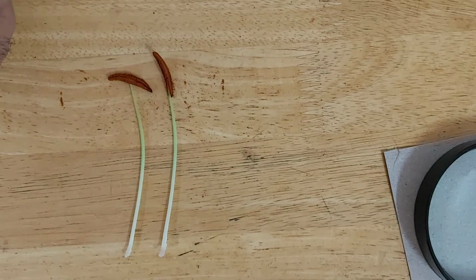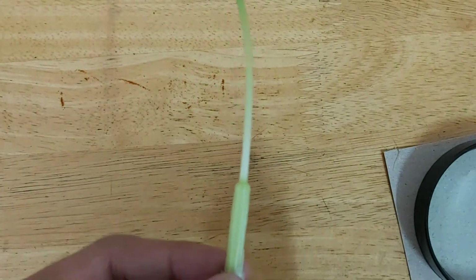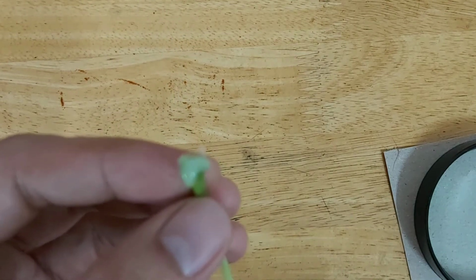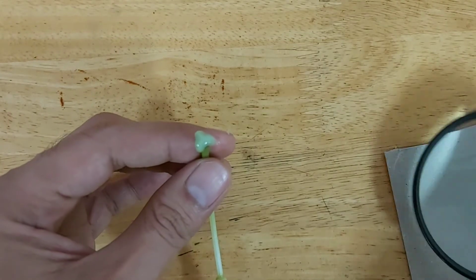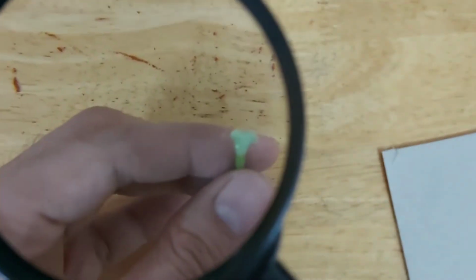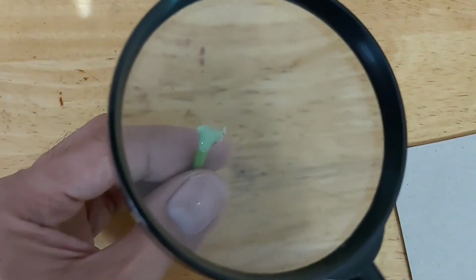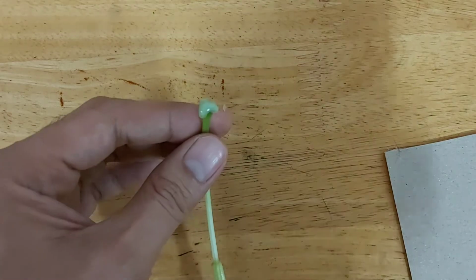Now we have 6 stamens. Let's just set those aside first. Then the remaining part will be the carpel. So this is the carpel now. In the carpel, of course, we have the stigma, which is at the top, and you can see there is some sort of liquid on the stigma. That liquid makes the stigma sticky.